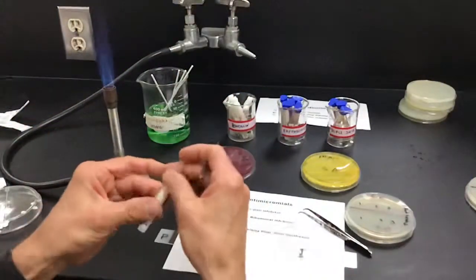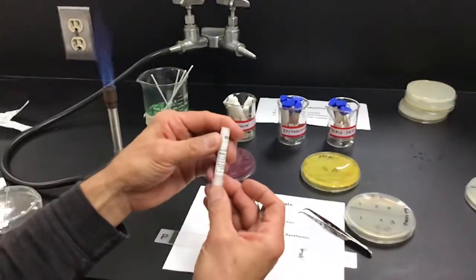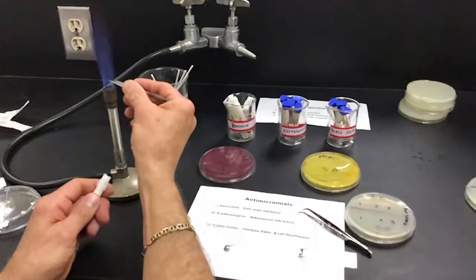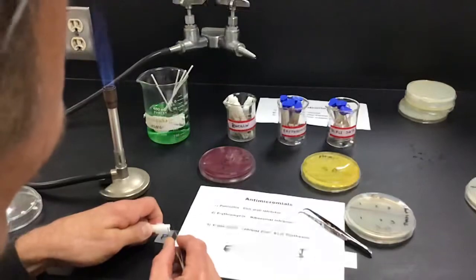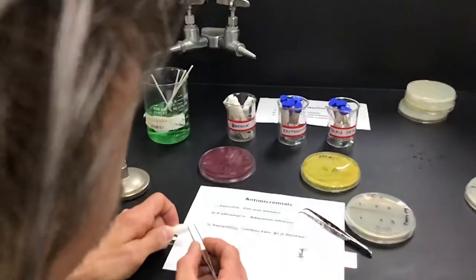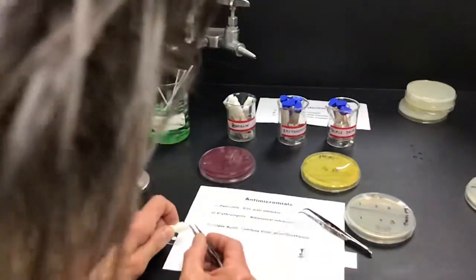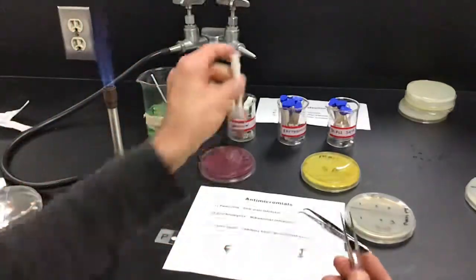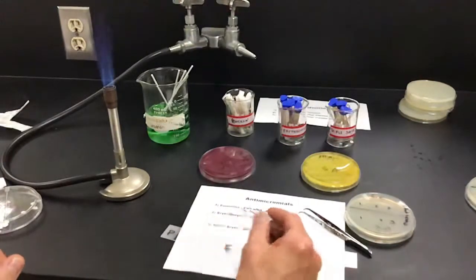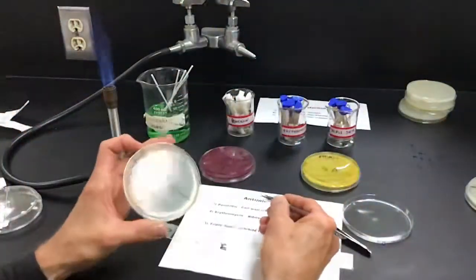So I'm going to try not to drop these. Where is it? It says penicillin right there, if you can see that. So sterilize this. Pop that disc out there. Pop another one out here. So once again, we have one for our gram-negative and one for our gram-positive. Okay. Well, that's no longer sterile, but it's all right. So this is going to be our number 1.